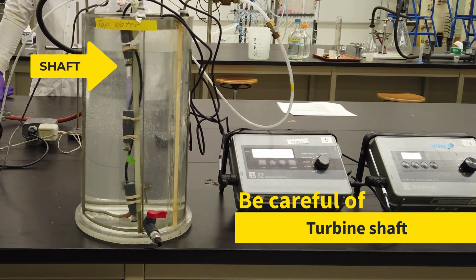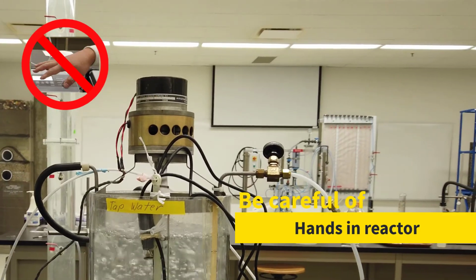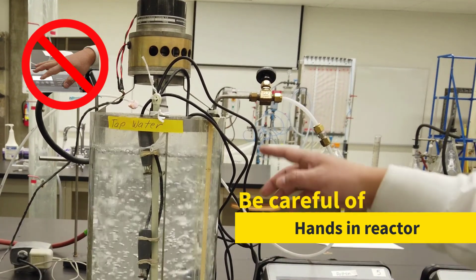While operating the turbine mixers, make sure that items do not become wrapped around the turbine shaft. Do not put your hand into the reactor while in operation.